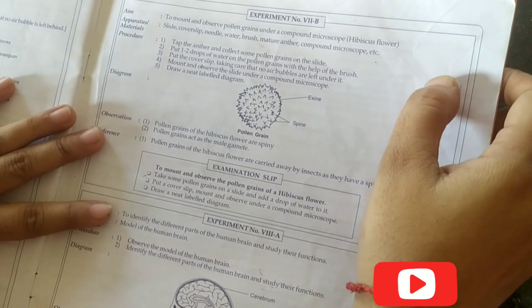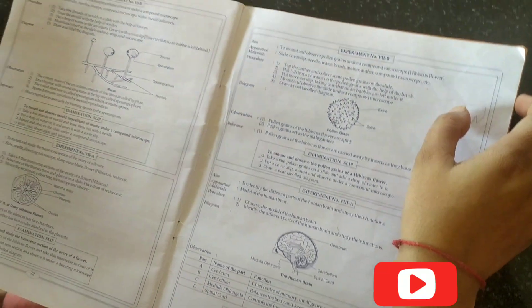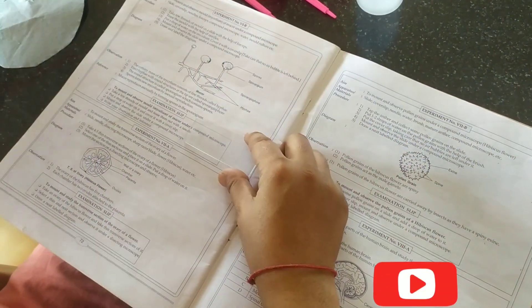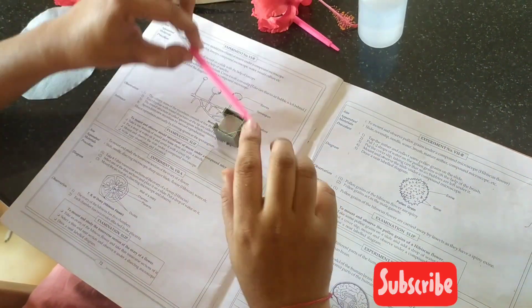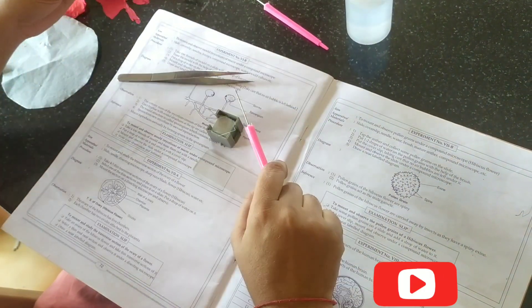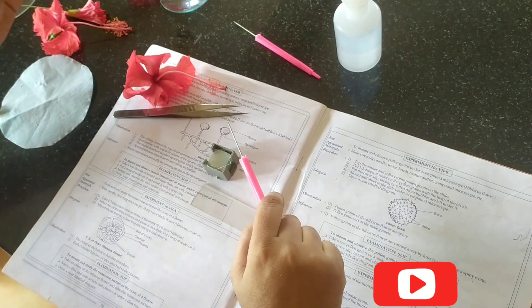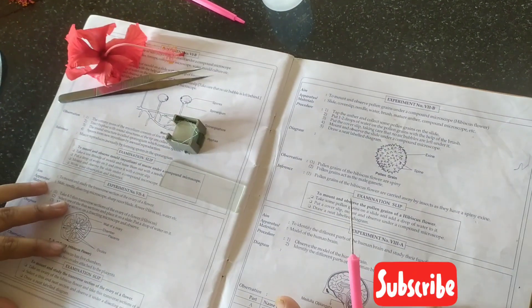The apparatus or materials required are: a slide, cover slips, a needle, flowers with anthers containing pollen grains, and a compound microscope.